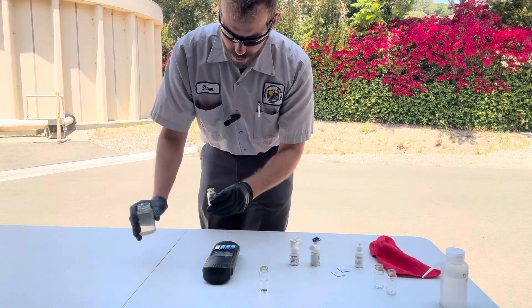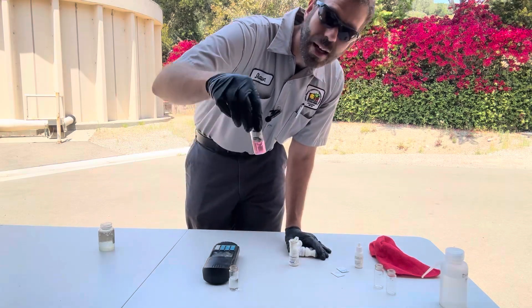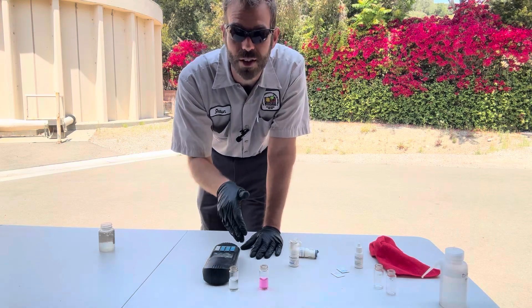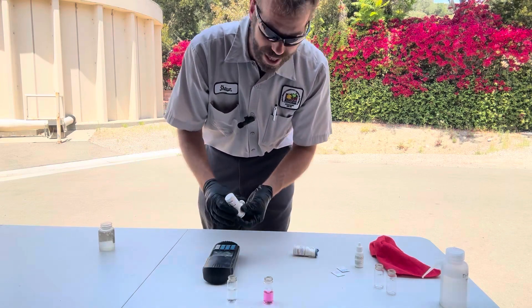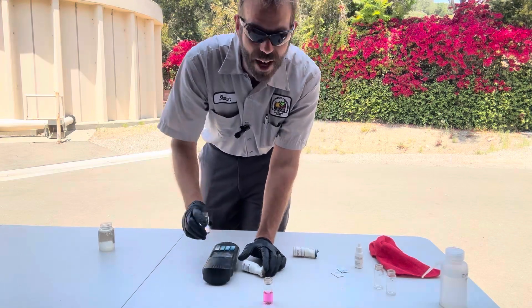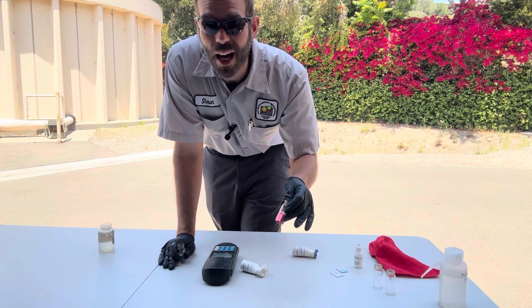I'm not going to do a high range, I'm going to do a low range. First I'm going to run total - you see it's turning pink. This is a three-minute test and that looks like a drinking water level - that's not good. I want a much stronger concentration than that if it's going to be total or combined. Now I'm going to hit it with free and you're going to see it's not going to turn a color - yeah, no free. That means I'm not break-pointed. I've got monochloramines in there and not a lot of them. These are not very powerful.